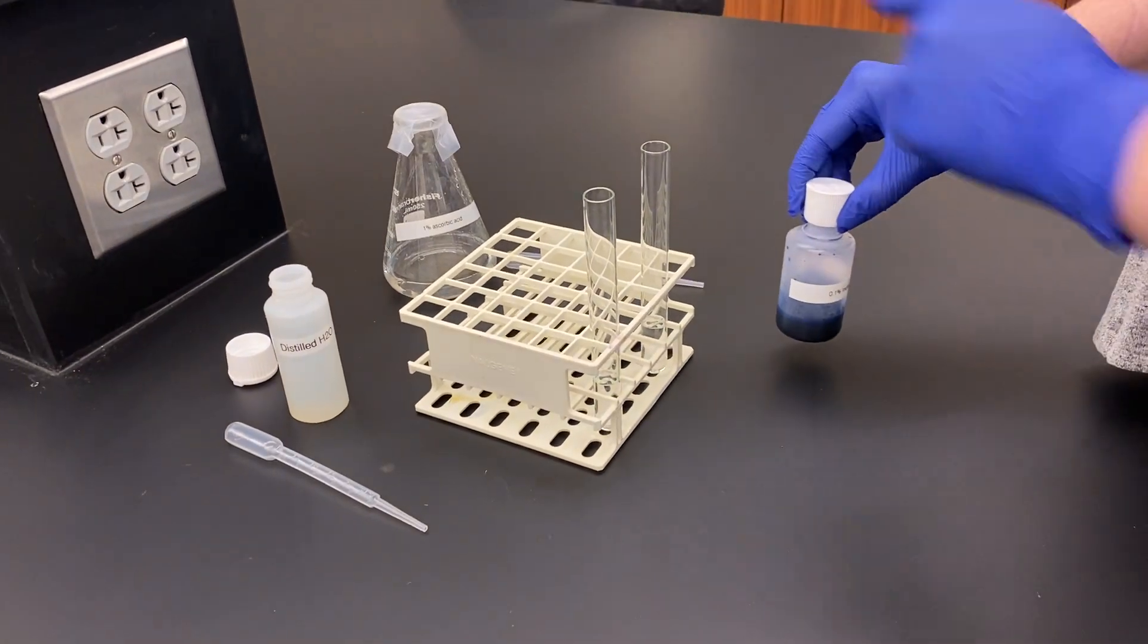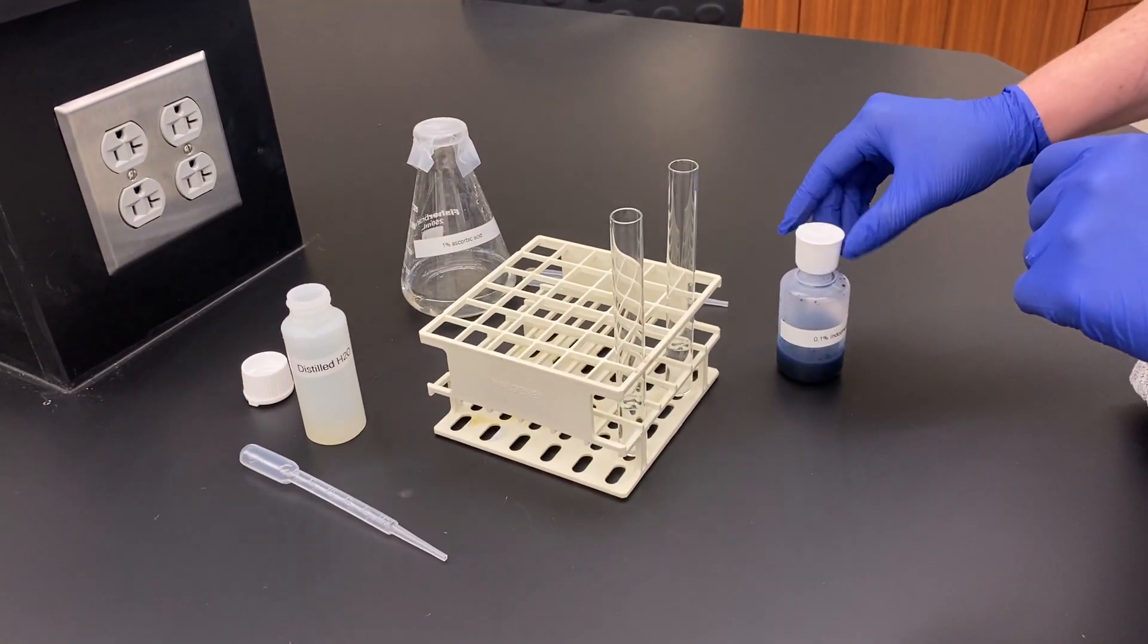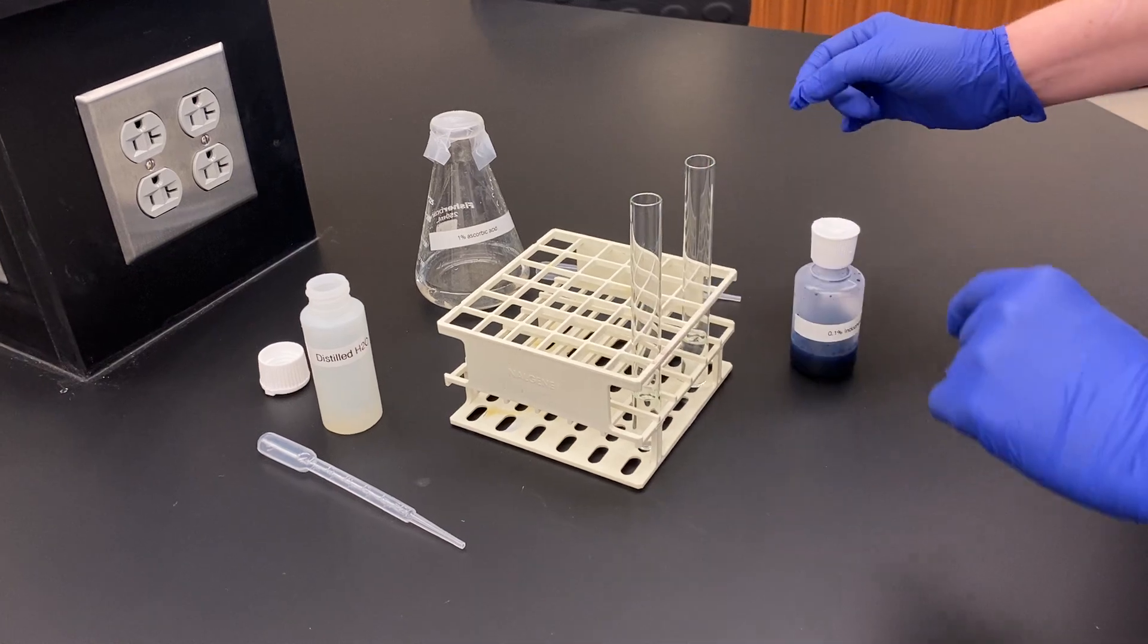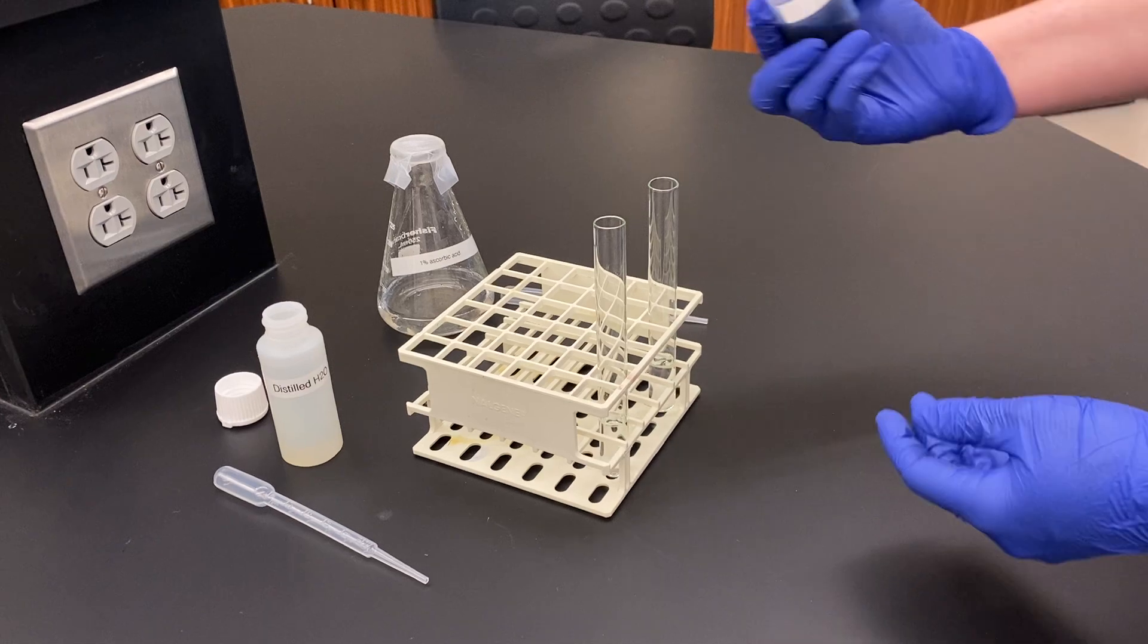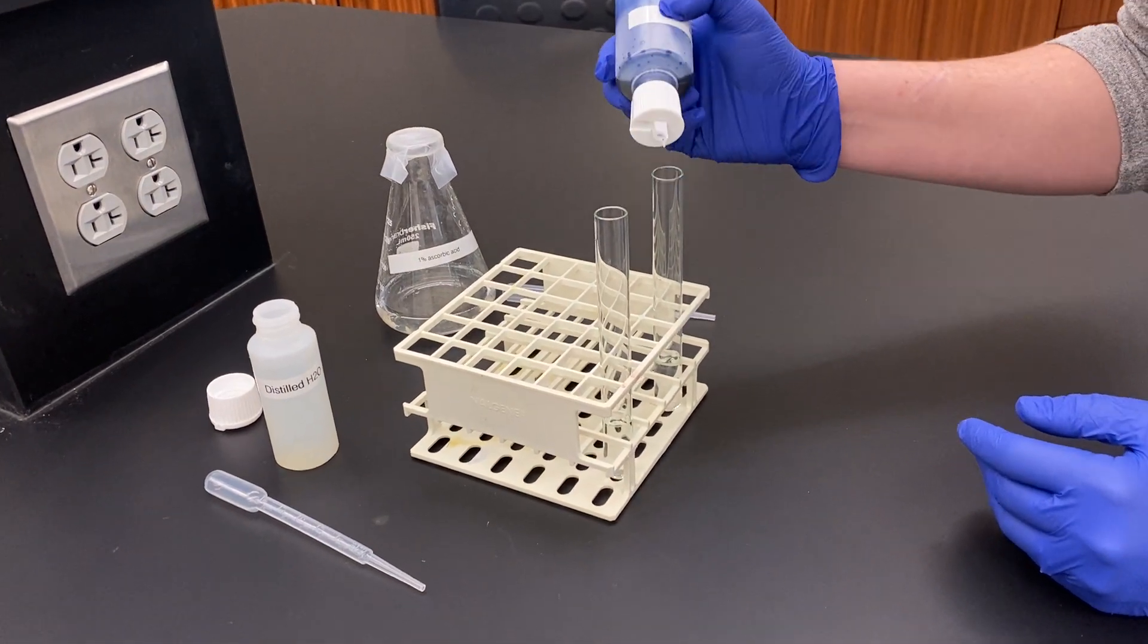And a positive control that we're going to have with vitamin C. Currently these two test tubes have five milliliters of water in them. I'm going to do the positive control first, so we're going to add 20 drops of this to each solution.